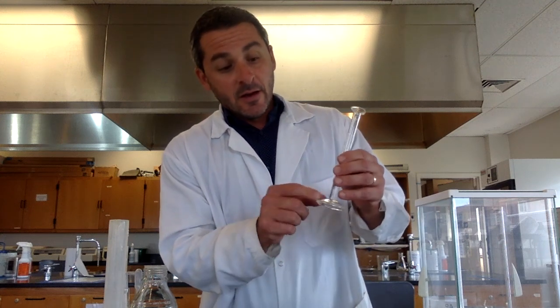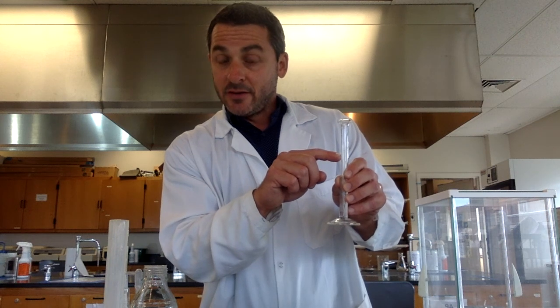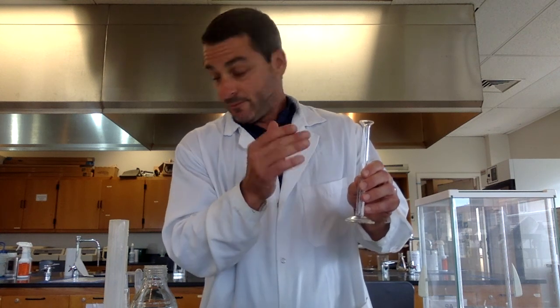All right, again, on this smaller graduated cylinder, it goes from 1 to 10. The little graduated marks in there are the decimals, so it's like 5.8, 5.9, and then I estimated the last one because it's really close to 6. So I said 5.98 milliliters. Okay, so that's the volume.